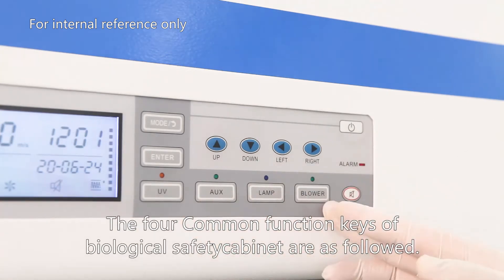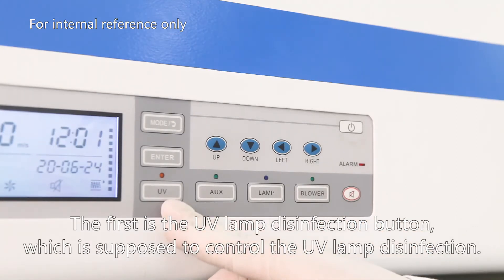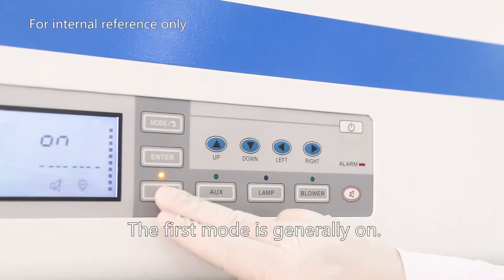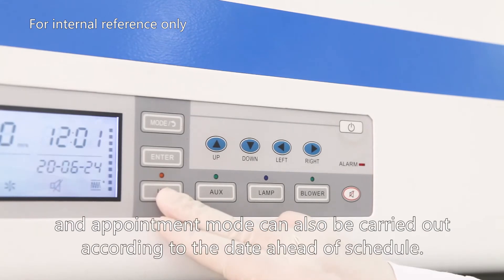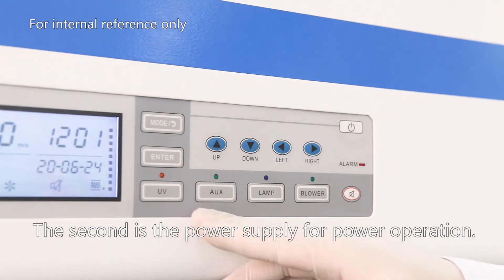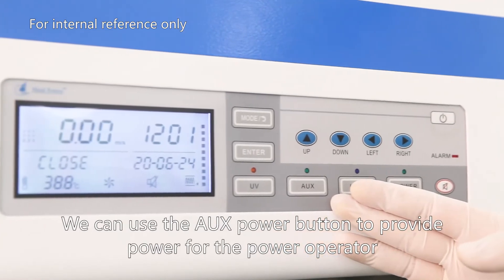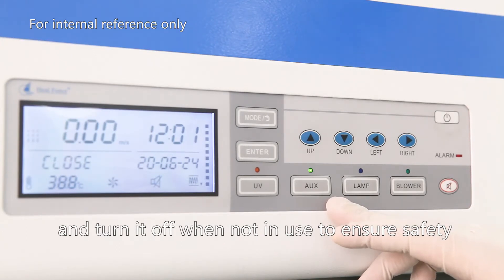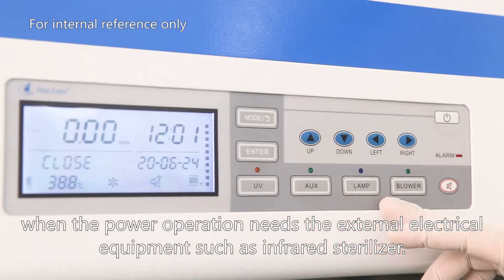The four common function keys of the biosafety cabinet are as follows. The first is the UV lamp disinfection button, which controls UV lamp disinfection. The first mode is generally on; the second is a fixed time mode of 30 minutes or 60 minutes, and an appointment mode can also be carried out according to the date ahead of schedule. The second is the AUX power supply button, used to provide power for external electric equipment such as an infrared sterilizer, and turned off when not in use to ensure safety.